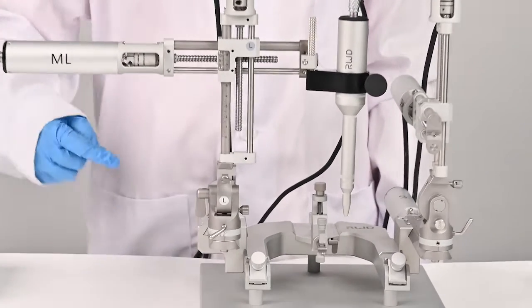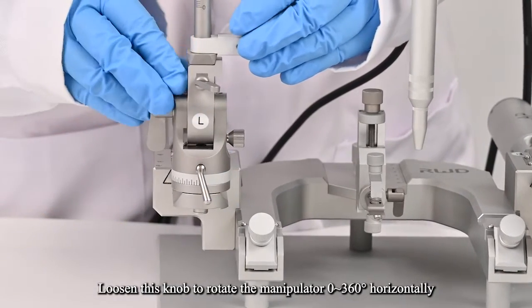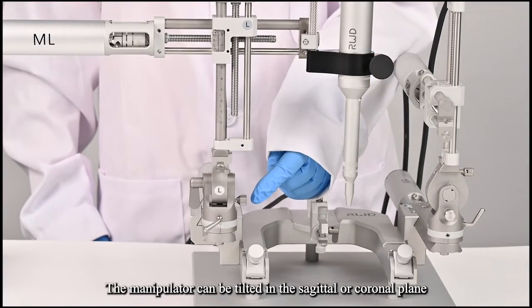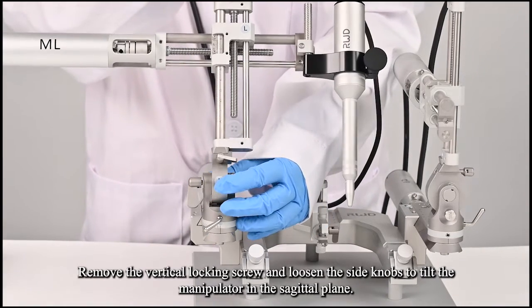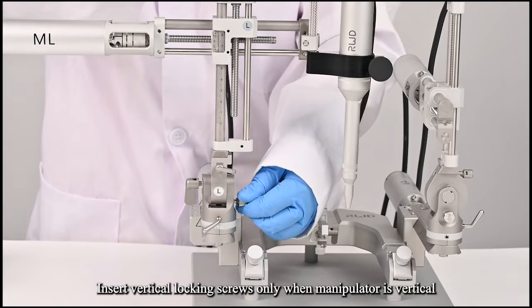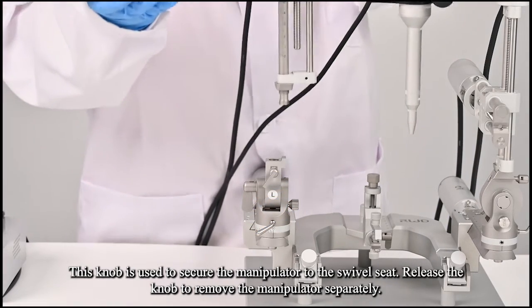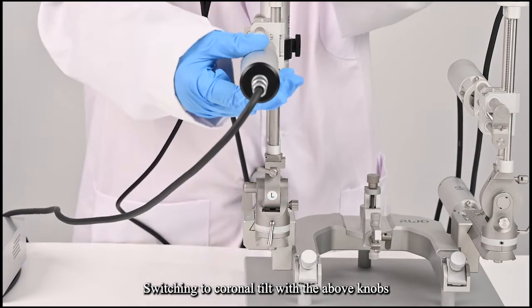Manipulator adjustment: loosen the knob to rotate the manipulator from 0 to 360 degrees horizontally. The manipulator can be tilted in the sagittal or coronal plane. Remove the vertical locking screw and loosen the side knobs to tilt the manipulator in the sagittal plane. Lock the side knobs after tilting to the target angle. Insert vertical locking screws only when the manipulator is vertical. Use the designated knob to secure the manipulator to the swivel seat; release the knob to remove the manipulator separately. Switching to coronal tilt uses the above knobs.